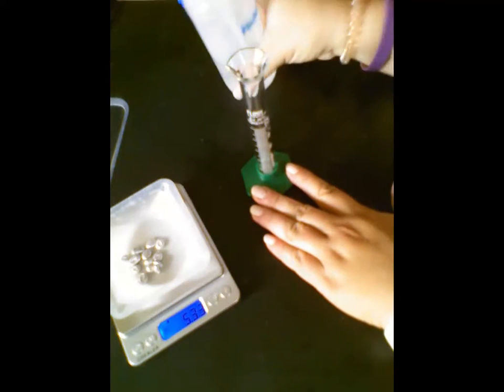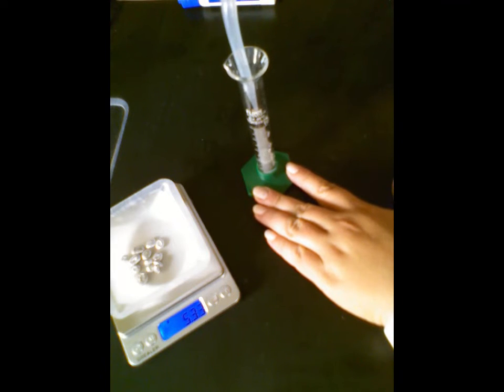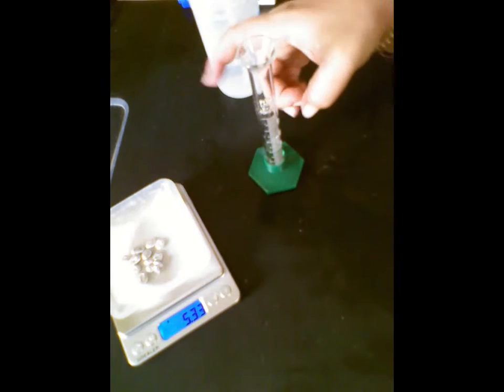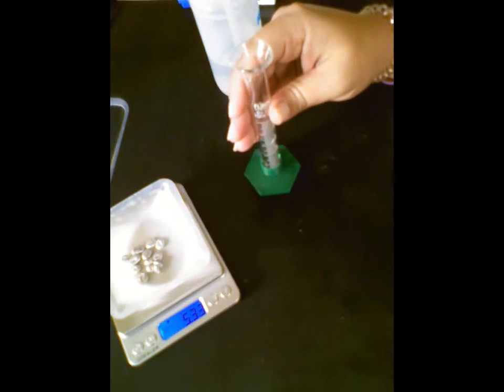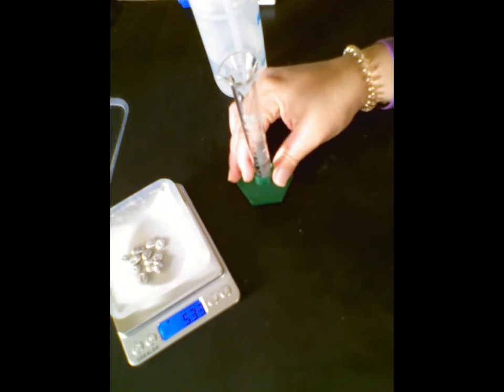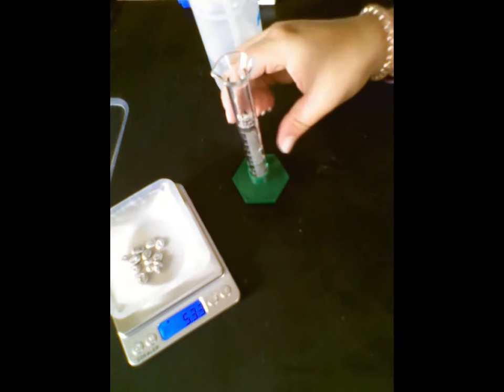Using my squirt bottle, adding water, I'm going to make sure that I measure from the meniscus of the water, where it dips down in the middle. That's the spot that I'm looking for to make sure that I am at 4 milliliters. That looks pretty well set up here. I'm not sure how well you can see it. I'll take a picture and put it on the next slide so that you can see exactly what that looks like at 4 milliliters.